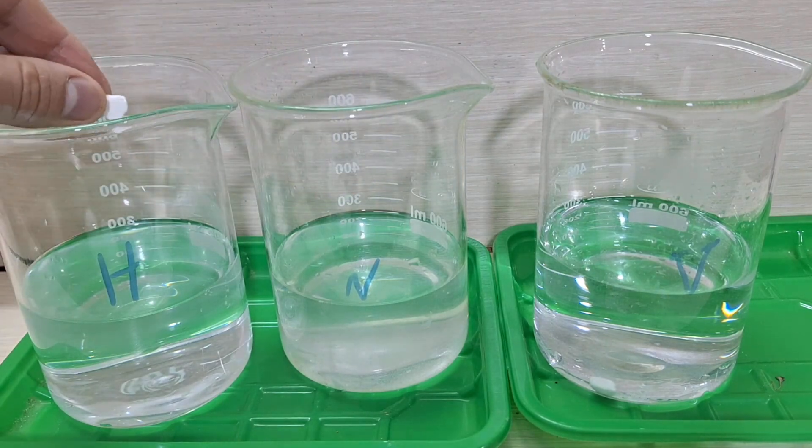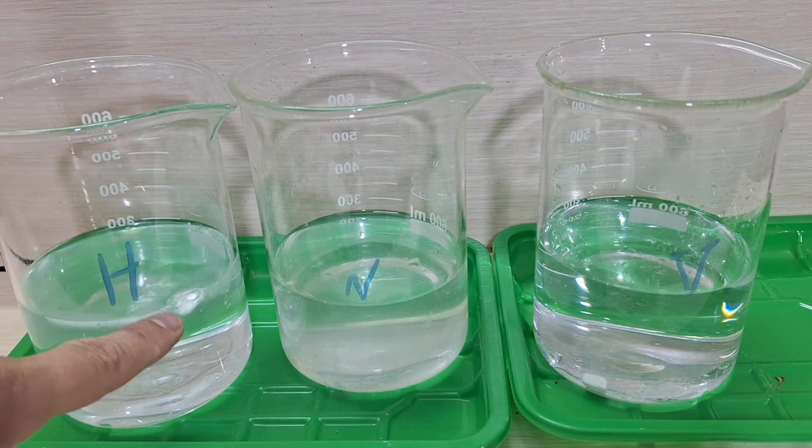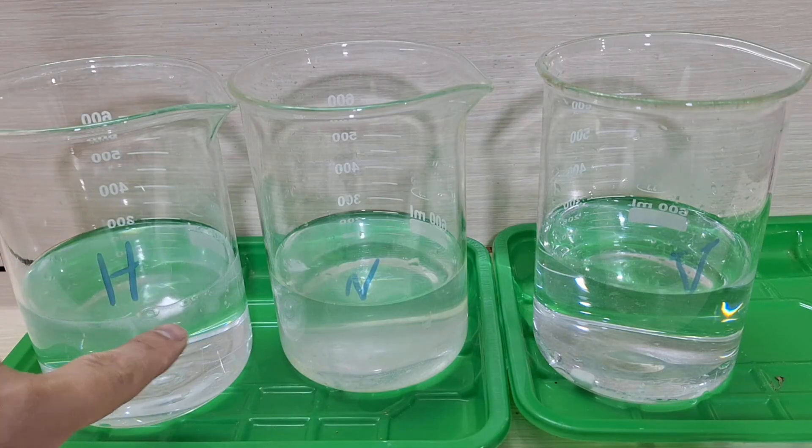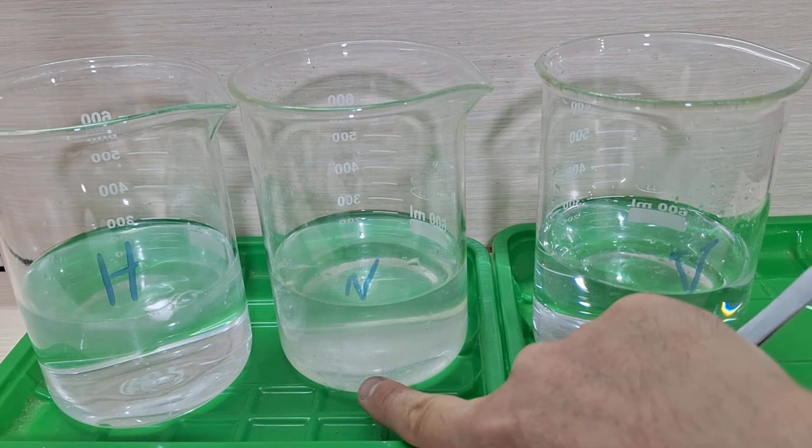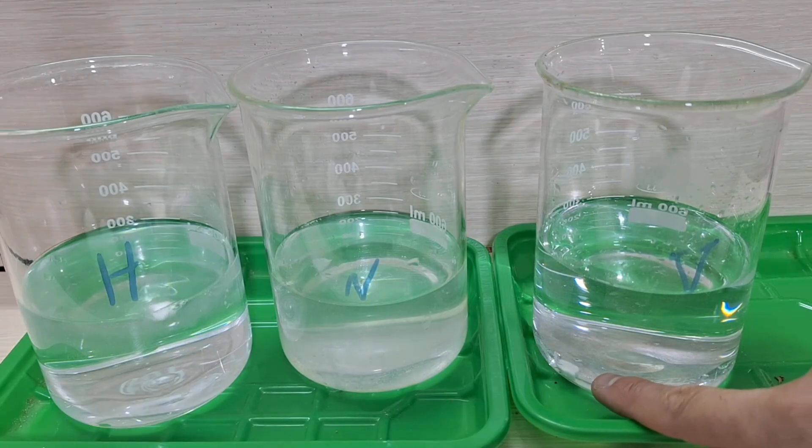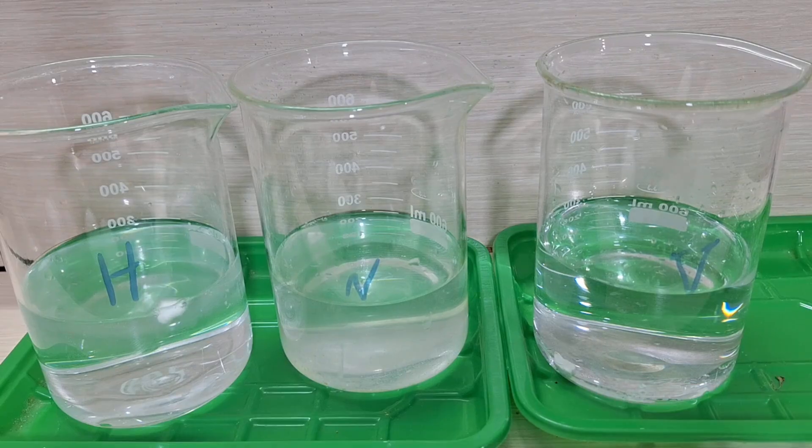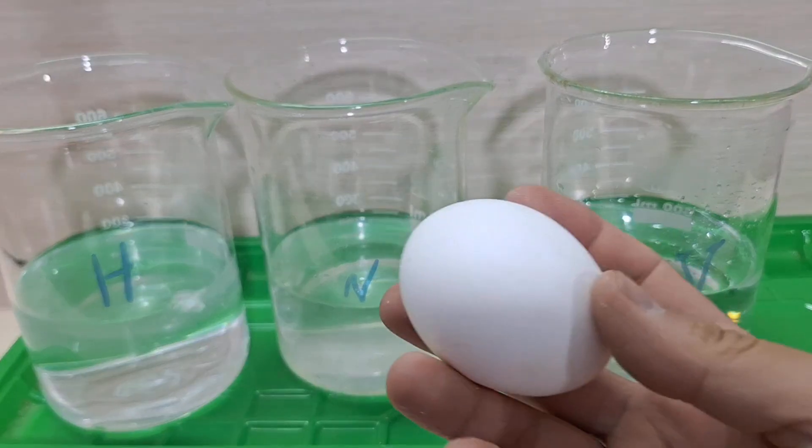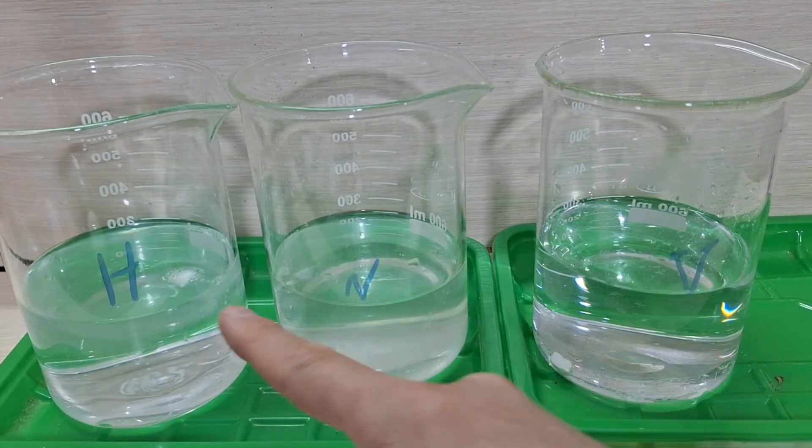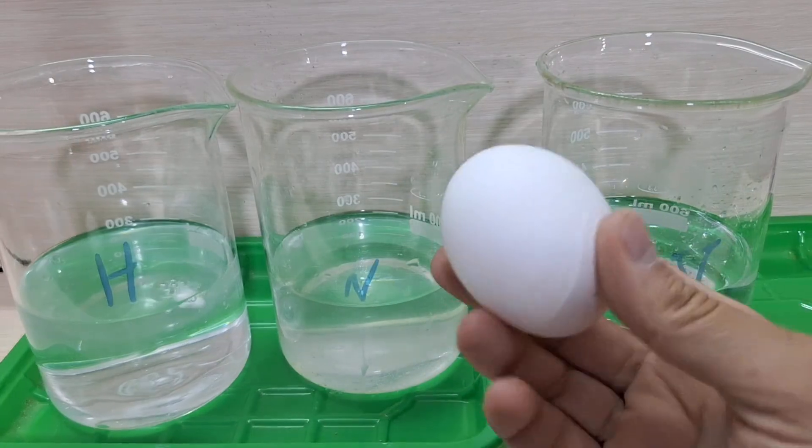Of course, I'll test this more thoroughly in another video. Interestingly, eggshell can act as a precipitating agent in chloride solutions. When we want to precipitate elements like gold or copper from a chloride solution, we gradually neutralize the acid. You might ask, how?